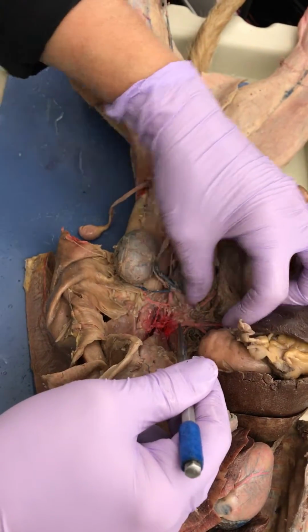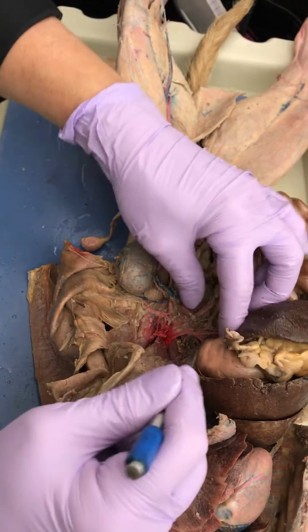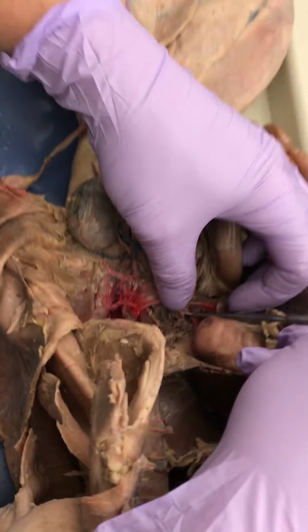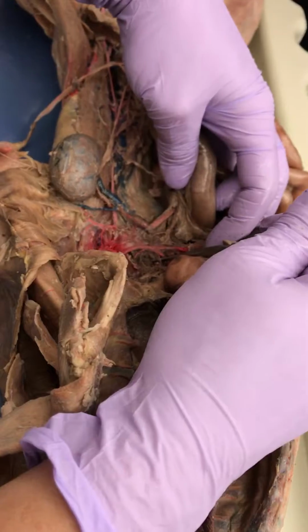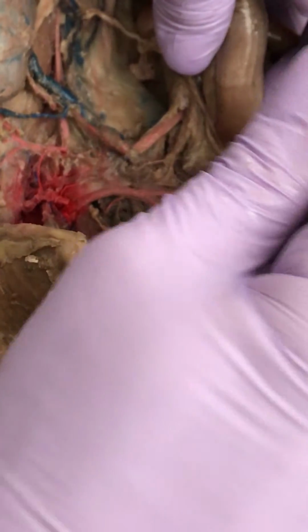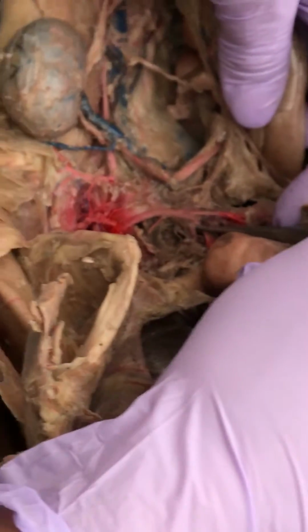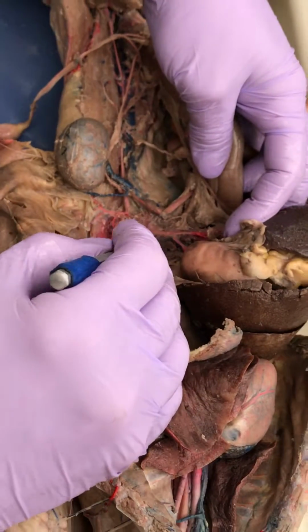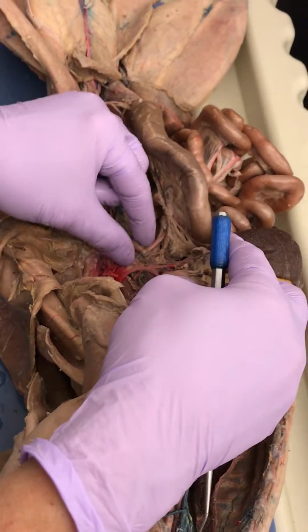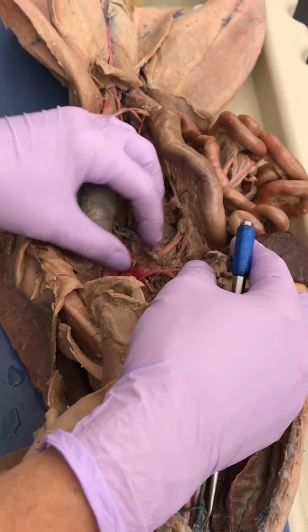Okay. This artery. Celiac. Okay, did you guys find the hepatic? Yeah, you did. Look. Hepatic artery. You had to reach in there and grab it. Right, yeah. It's because it's underneath there. It's hiding. And then there's a lot of stuff there. Yeah. So, hepatic. How about this one? Gastric. How about that one? Splenic. That's good. What's this little bean? Adrenal gland. Okay.